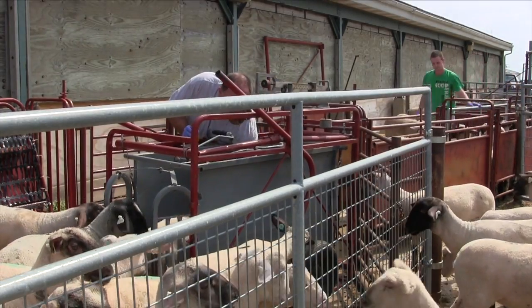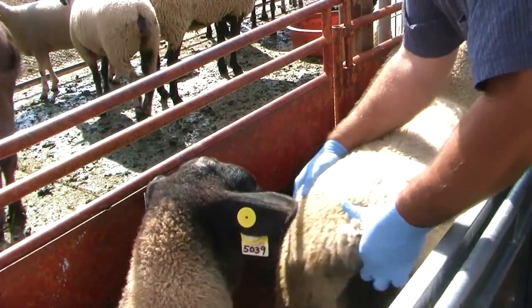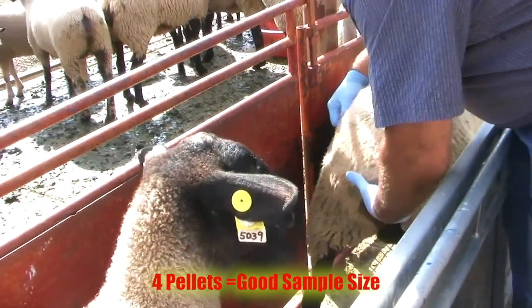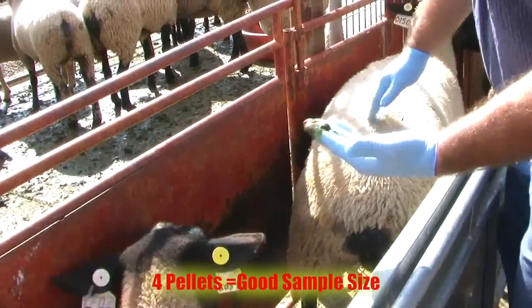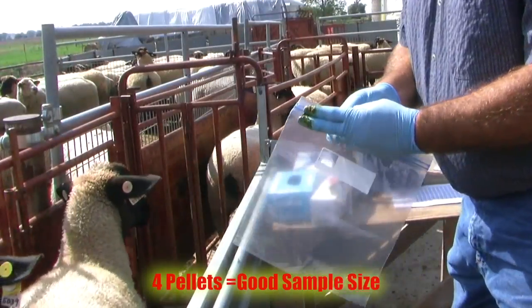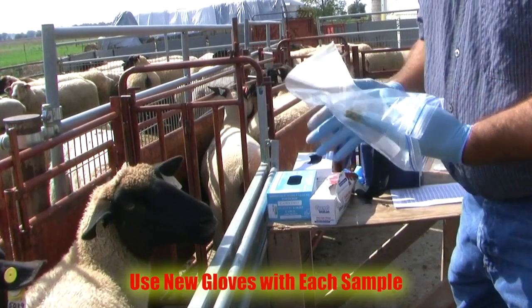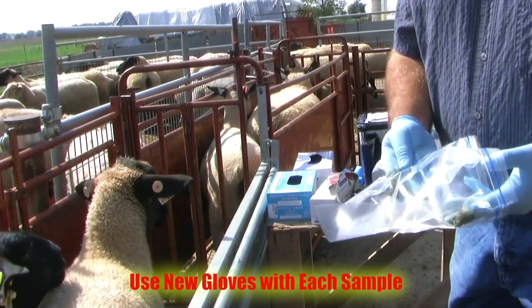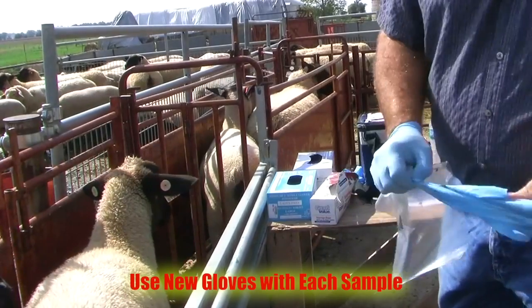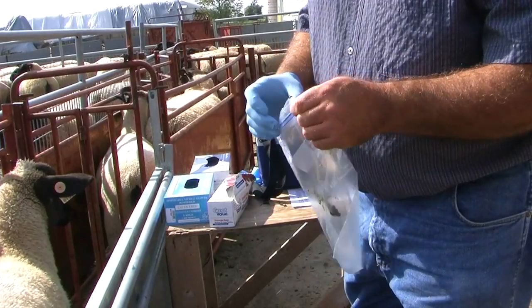A crucial part of an FEC is the fecal collection itself. The fecal matter is best collected directly from the rectum. This allows the sample to be fresh and mostly free from foreign debris. The cleaner the sample, the easier it is to view the eggs under the scope. This can be done by selecting the animal you want to test and collecting the feces from the rectum using surgical gloves. This allows for higher accuracy on an individual level — you specifically know that the sample came from a specific animal. If you simply pick feces off the ground, you cannot treat on the individual level.